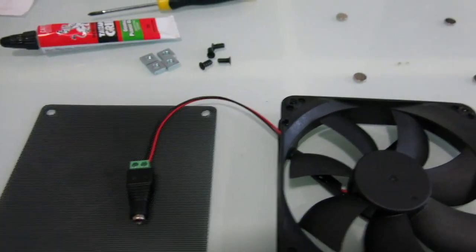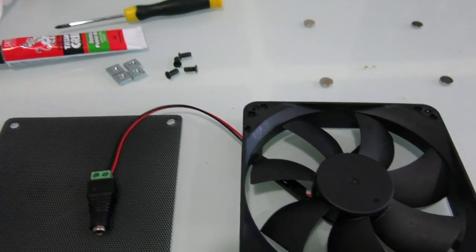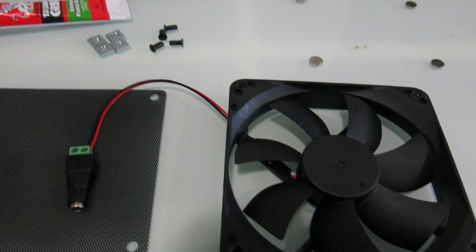All right. So I'll put you on high speed while I put it all together, and then you'll be able to see how it's done.